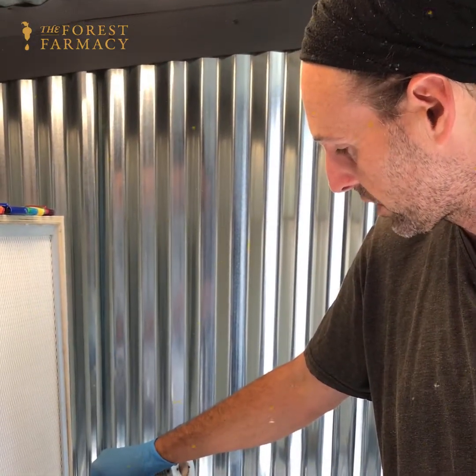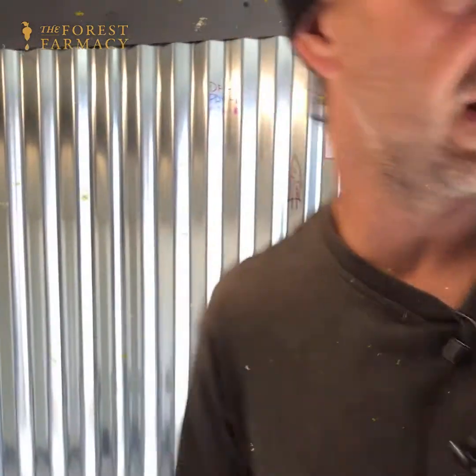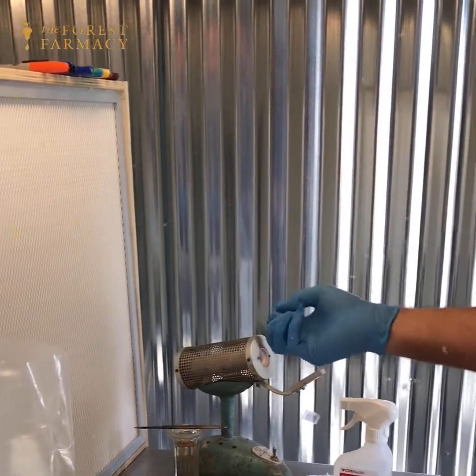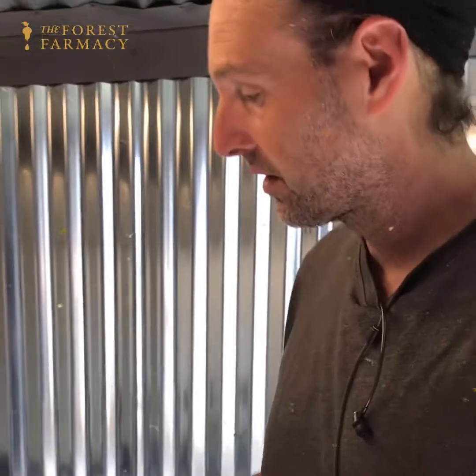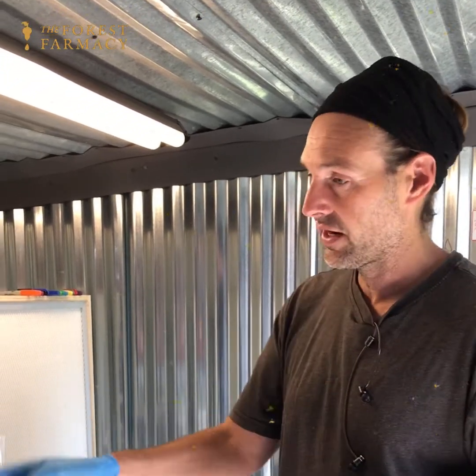I quench the scalpel but don't quench it completely — I let it stay warm so it can evaporate the water that's in the alcohol afterwards. Then I immediately wrap my petri plate back up because I don't want it to get contaminated.